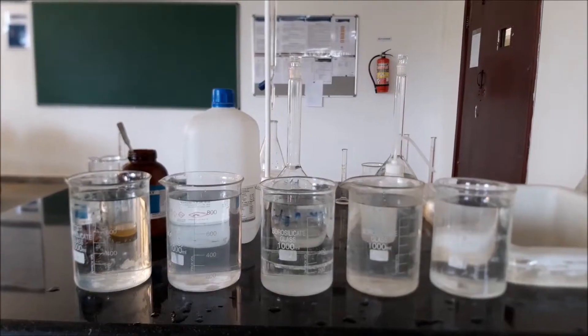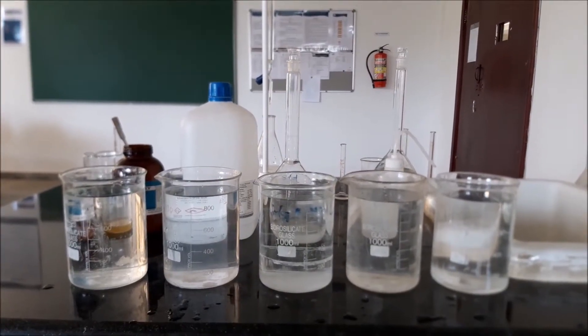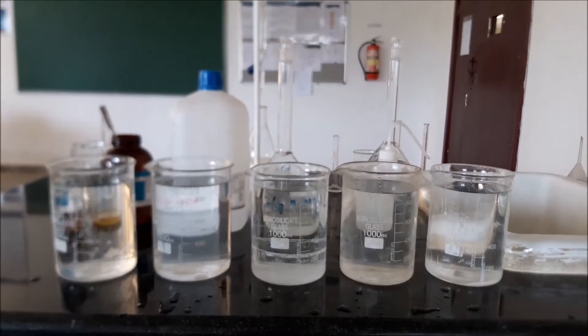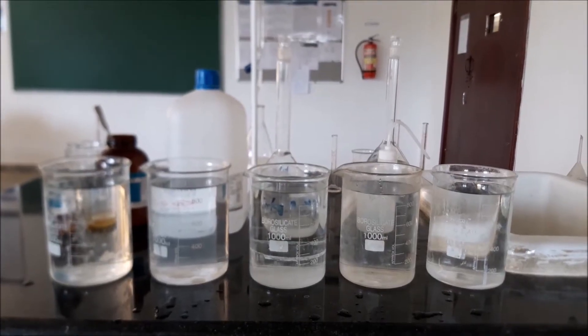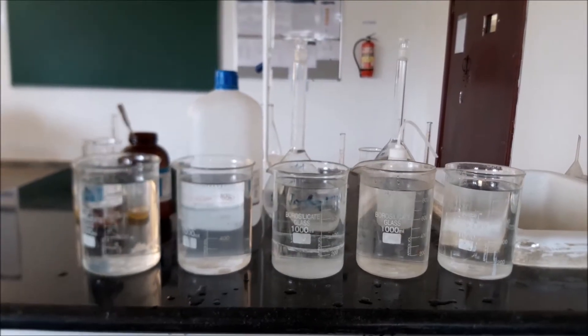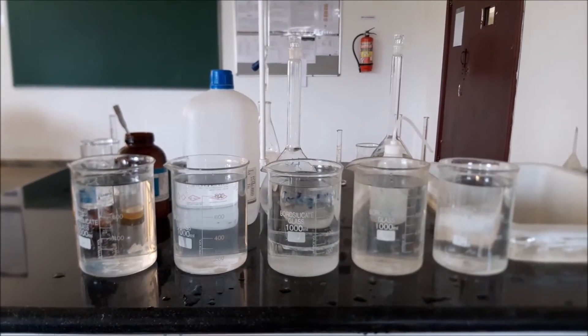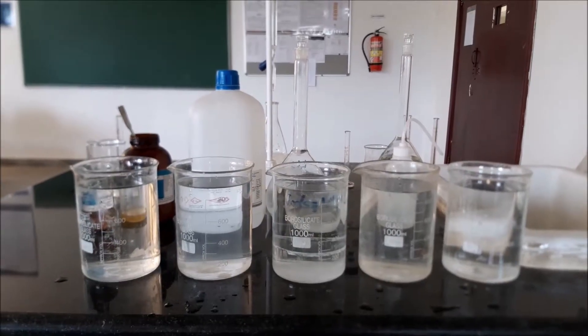We are supposed to add two, four, six, eight, and ten ml of bleaching powder solution to the respective beakers. The same procedure as for the residual chlorine test is being repeated.